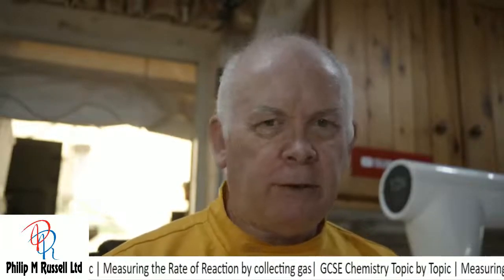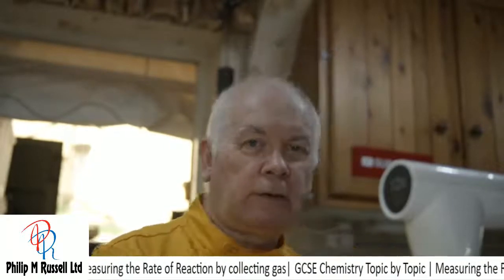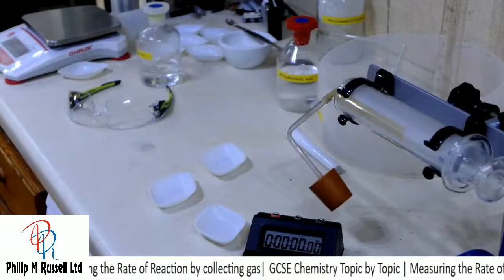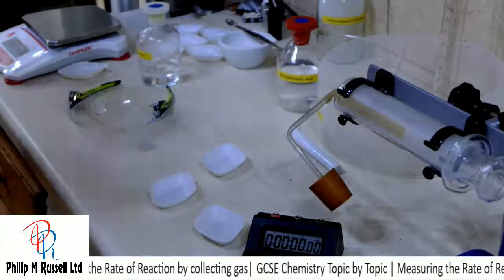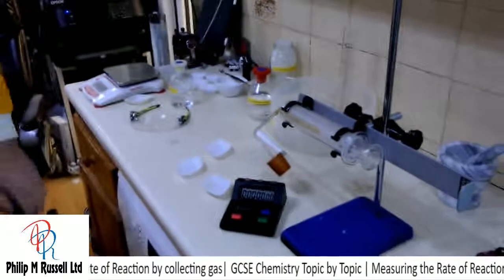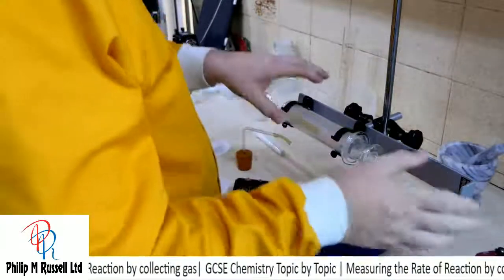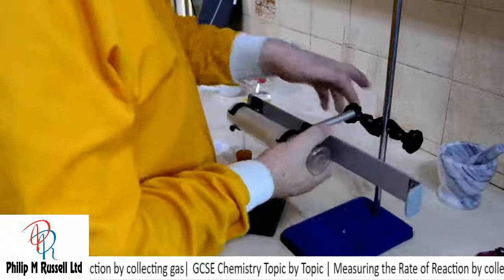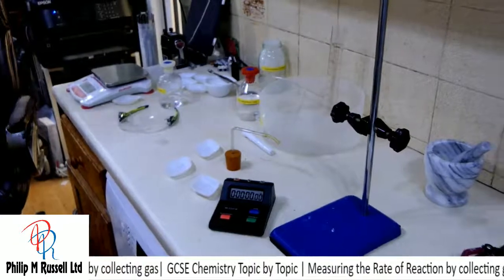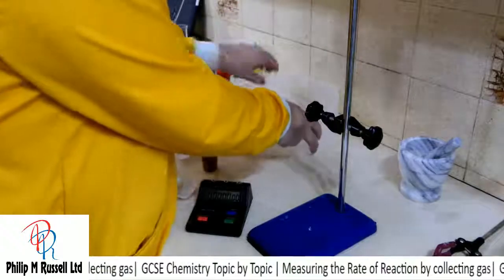So let's see if we can do the same experiment again, but I'm going to use a different setup. So let's go over and have a look. Now, in this setup, what we're going to have a look at is collecting over water. So I'm going to take my gas syringe out of the way and move it out of the way. And I'm simply going to do that because that's an expensive piece of kit. And what we're going to do is we're going to collect over water.